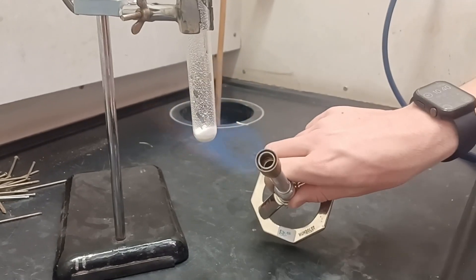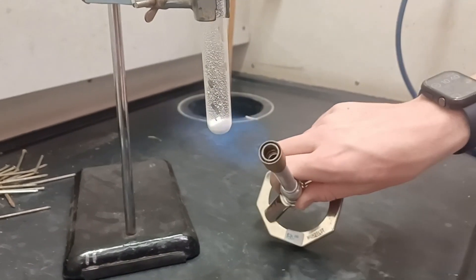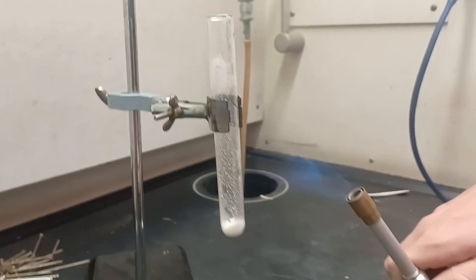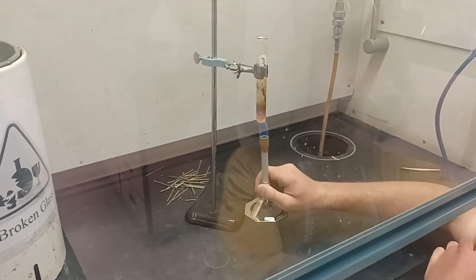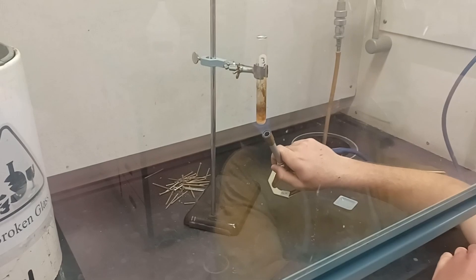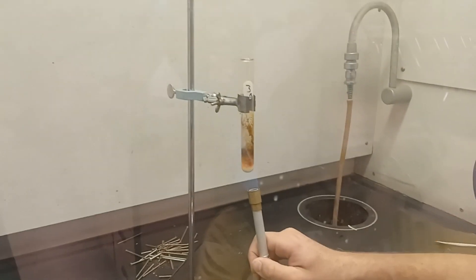The test tube is then gradually heated with a Bunsen burner. The mixture will release gas and gradually turn a brown color. It is important to take a couple of minutes to do so as to prevent further decomposition of the involved products and reactants.